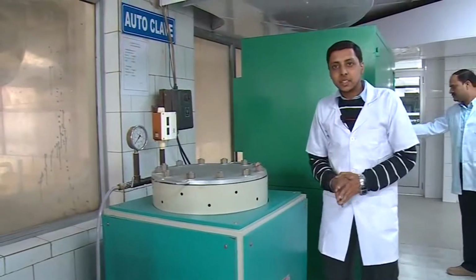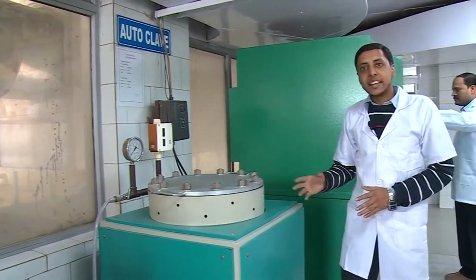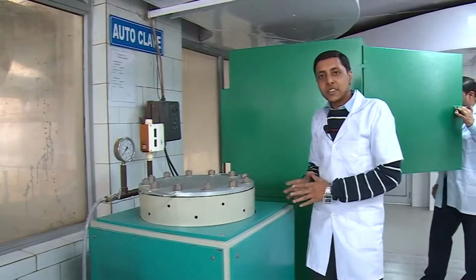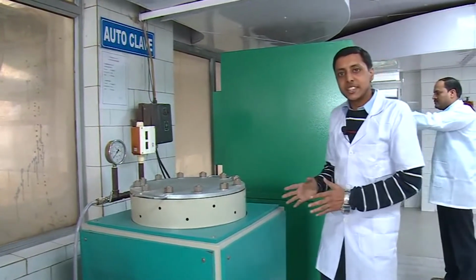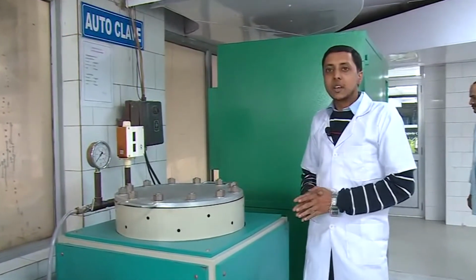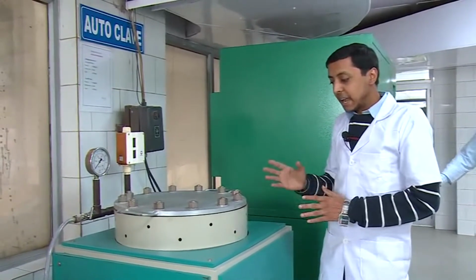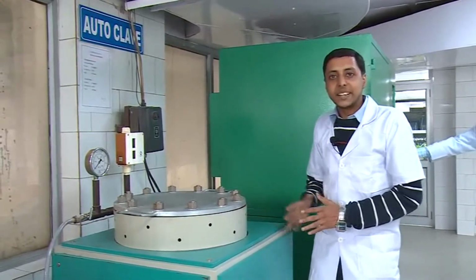This is the autoclave machine. Through this machine, the resistance to the formation of cracks or hair-like cracks is determined by subjecting a whole tile to high pressure steam, that is 750 plus or minus 20 kilopascal, with a steam temperature of 168 plus or minus 1 degree centigrade for 2 hours in this autoclave machine for one cycle. Then we examine the cracks by applying stain on the glazed surface. 5 cycles are required to complete the test.